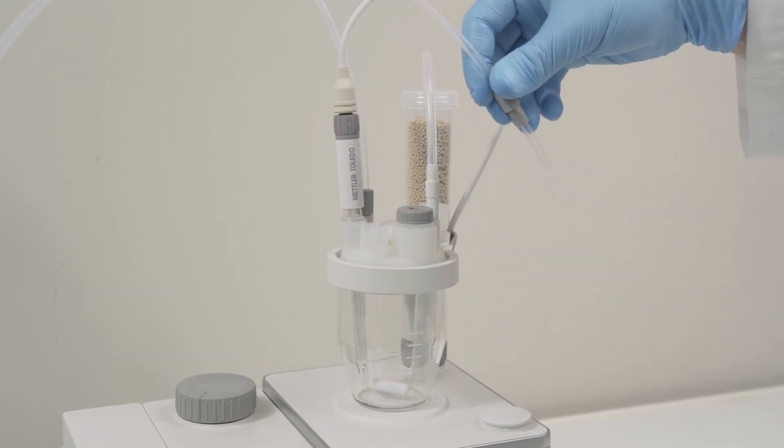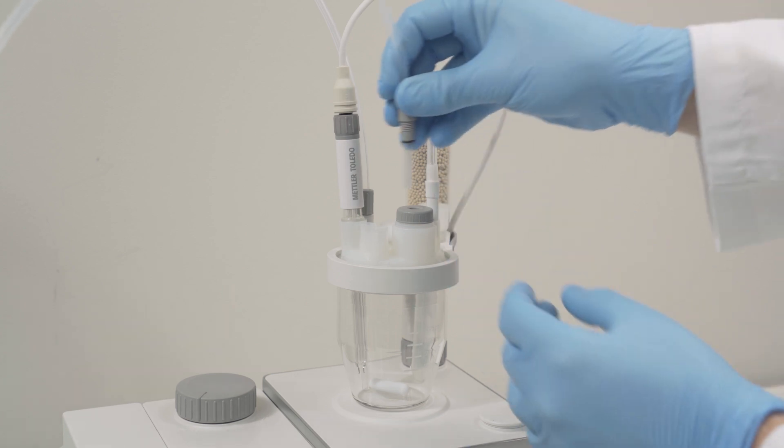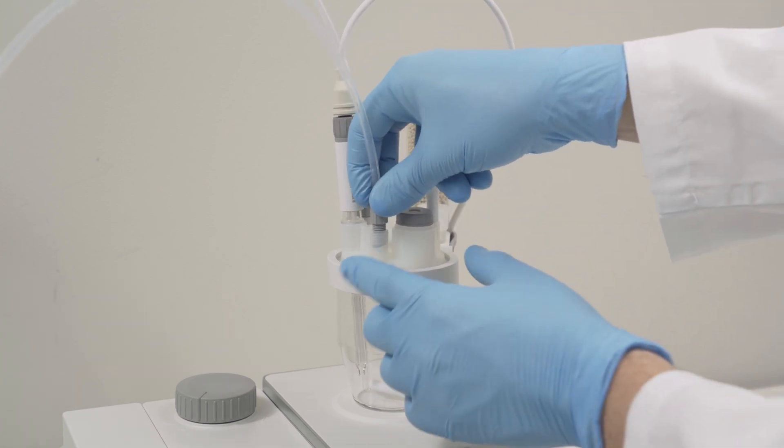The other end of the solvent tube is not pushed down completely until it reaches the bottom of the vessel. Here we leave it on top.